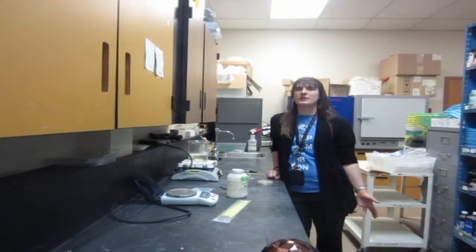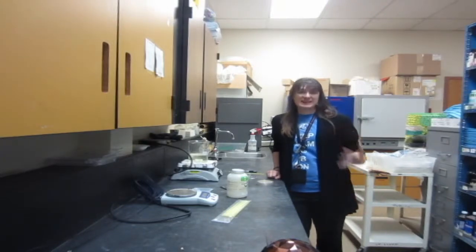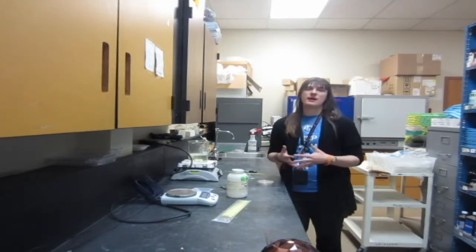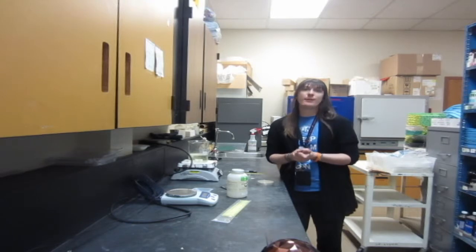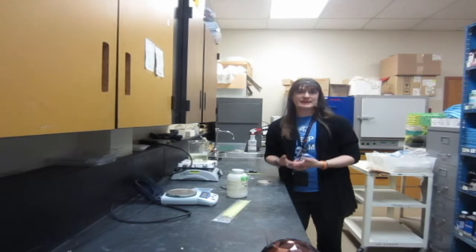Hello students! A lot of times you'll want to do experiments with bacteria, and in order to see how bacteria are growing you need to create some food for them. The way to do that is to create some agar. I'm going to show you here how to create agar plates so that you can test different variables with bacteria.